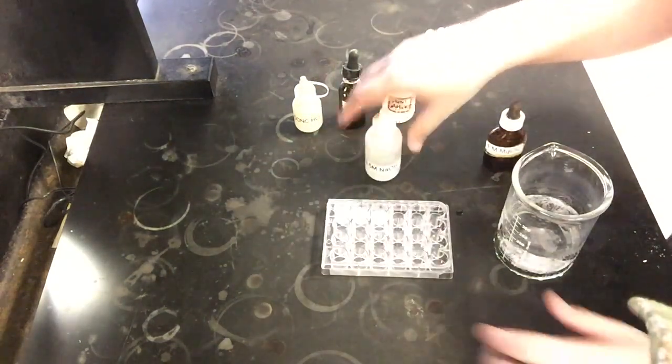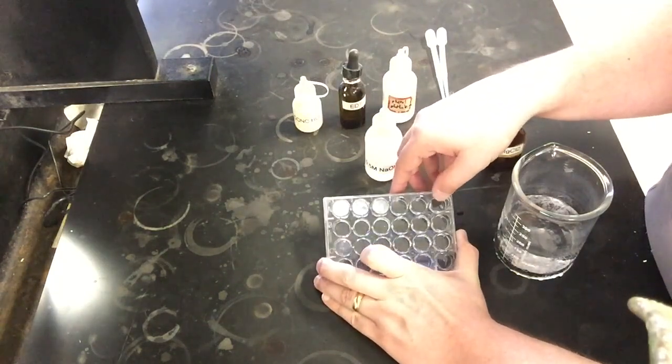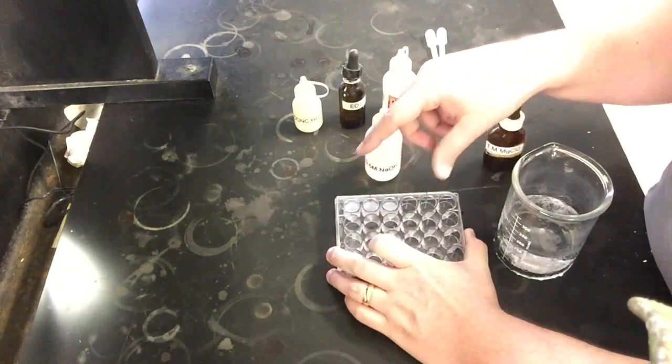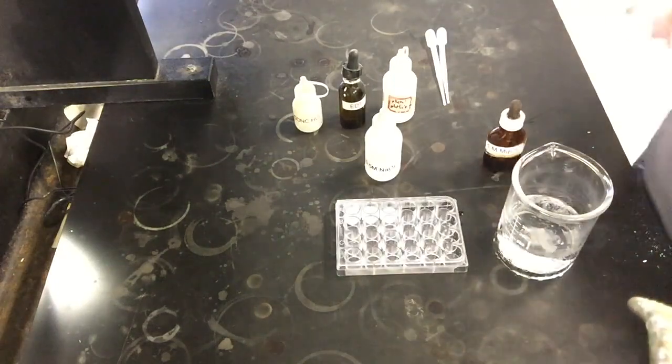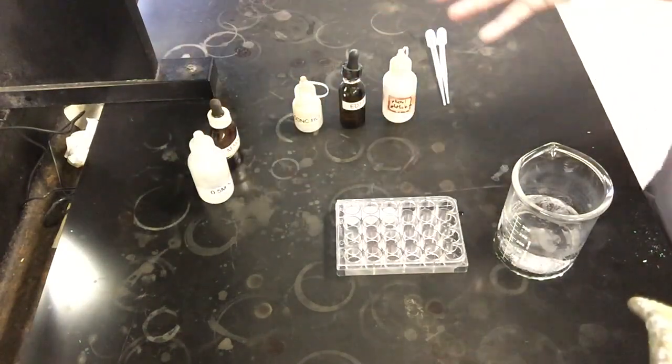And I'll tilt the well plate to the camera to have a little bit better view. Very white, cloudy solutions have now formed in here if I mix them all up. There's a bunch of white particulate both floating at the top and throughout the whole solutions. So now what I want to do is, with our procedure, take a look at adding some different components.